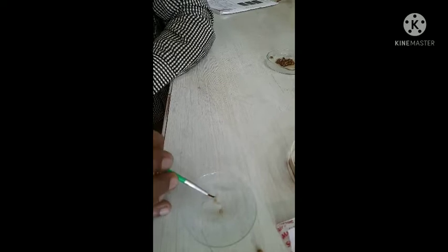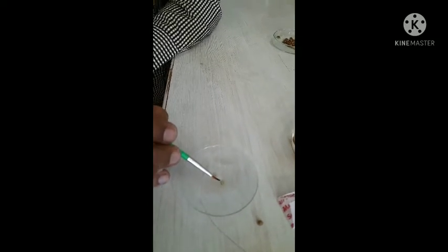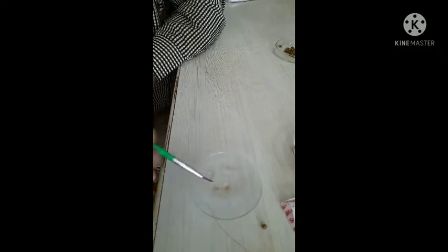Then, with the help of water, we clean the section, making it clear in appearance. We remove debris, fibrous material, or any other foreign particles present along with the section. We clean the section with water and then select a transparent section which is complete without any break in the watch glass. We directly bleach with the help of bleaching reagent.